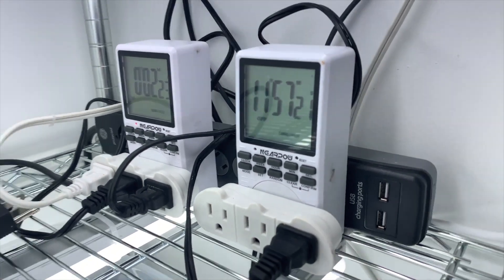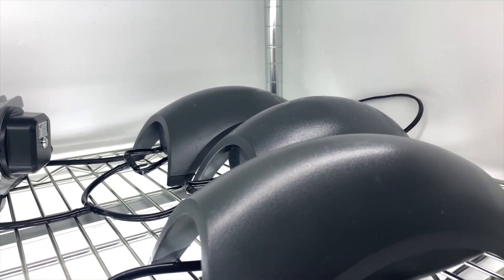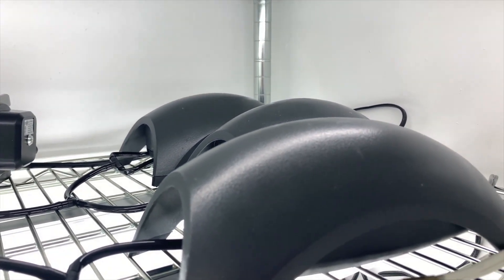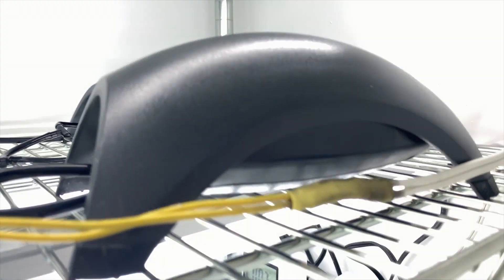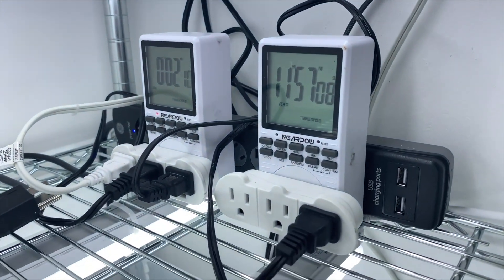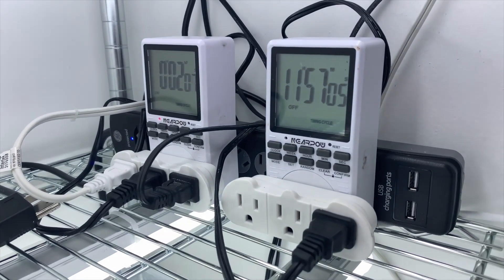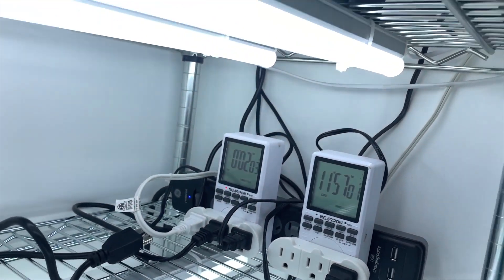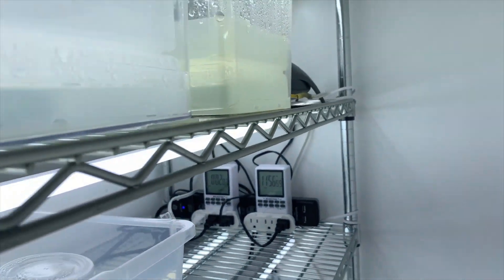With these aquarium pumps, it's not possible. It doesn't have enough power to run the temporary immersion bioreactors that I have quickly enough to do in 30 seconds. So that's why I do five minutes. And that's why I do five minutes every 12 hours.